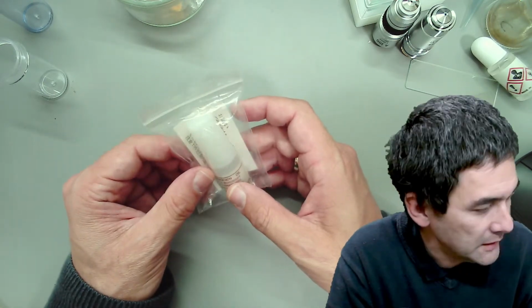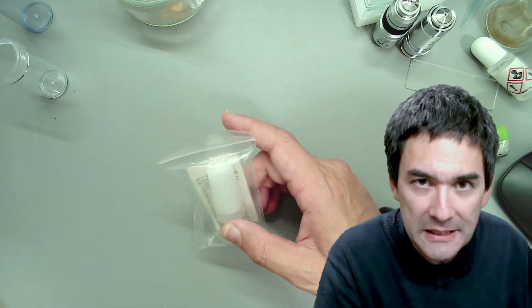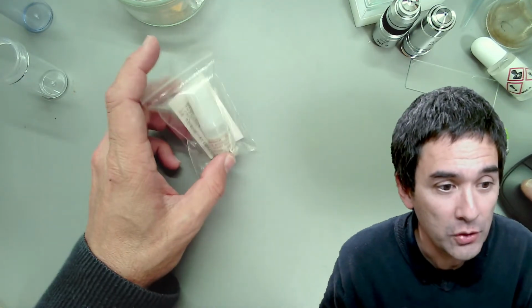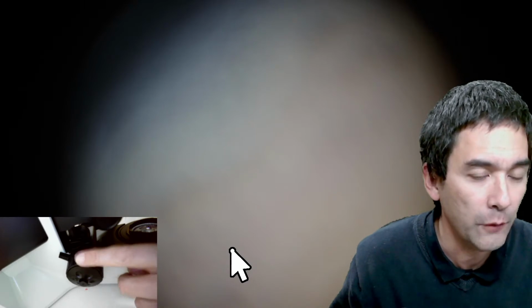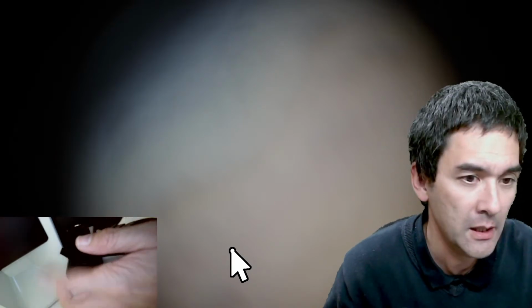So what next? I want to show you something right now, at the beginning, so that I don't have to show it to you later. I'm going to switch over to the microscope view, and what you have over here on the side is the focus knob, and there is a lever over here. I would like to explain this lever. Not all microscopes have this, but some do, and because I will be using this lever for oil immersion, I wanted to demonstrate what it does so that you understand better what I'm doing. It's not essential for oil immersion, but it makes life a lot easier.